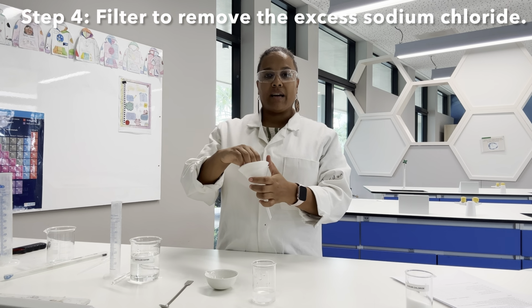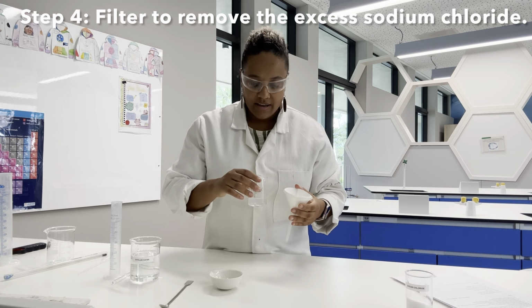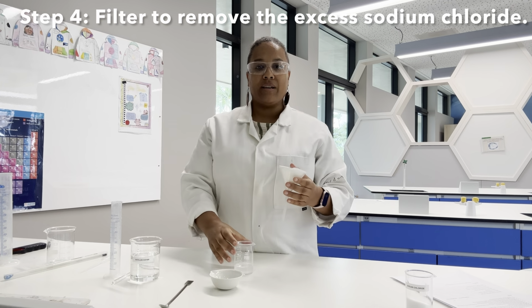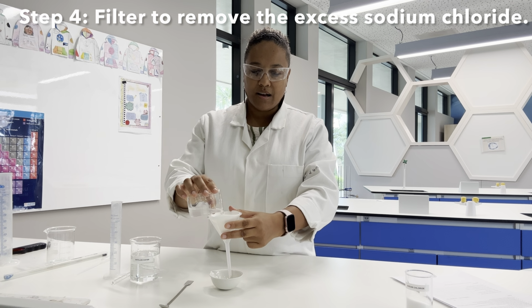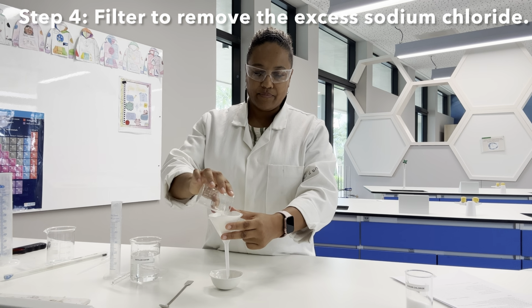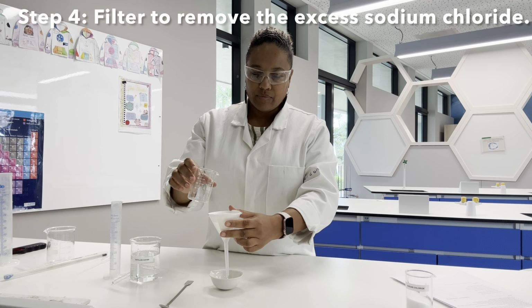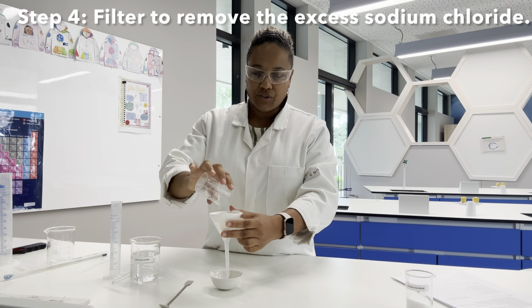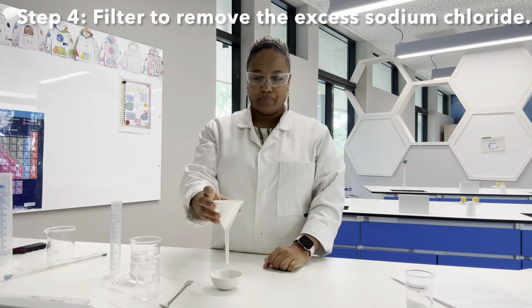Now I'm filtering just to get rid of the excess sodium chloride that did not dissolve, because remember we made a saturated solution, so some solid has been left behind. Okay, I'm going to make sure all of that solution goes through our funnel.